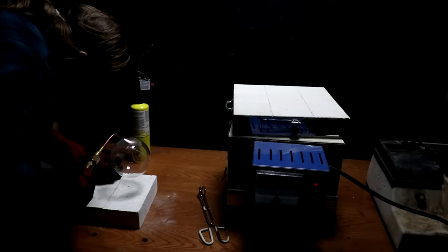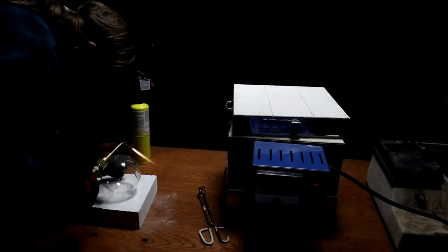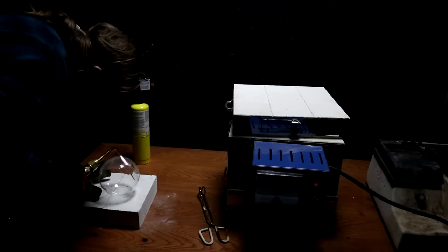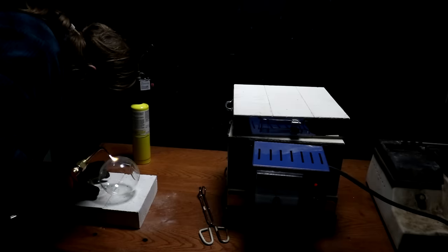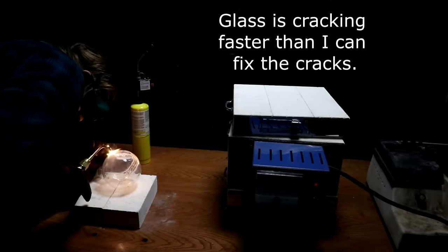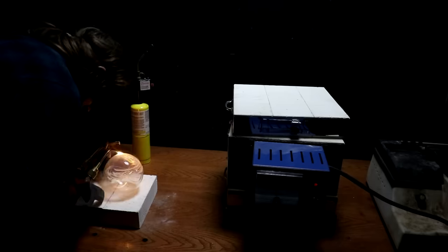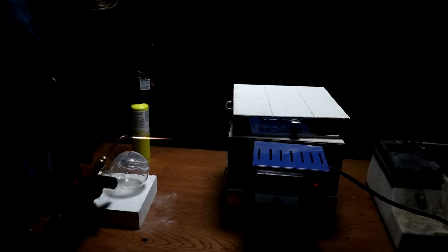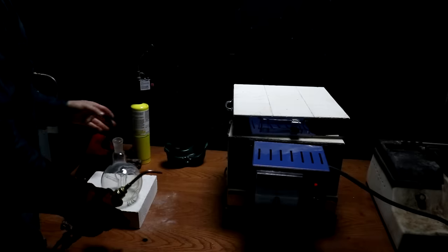Let's see if I can stop this crack from spreading. Okay, that's a little warm. Okay. Oh, that crack's just gonna get bigger. Yep, there it goes. Alright, this isn't working. I'm not able to keep the whole thing hot for long enough. Let's work on the other thing, see if we can get that to work.